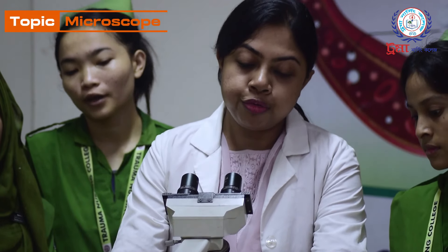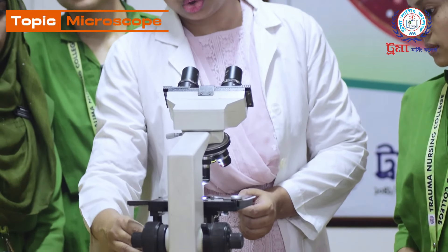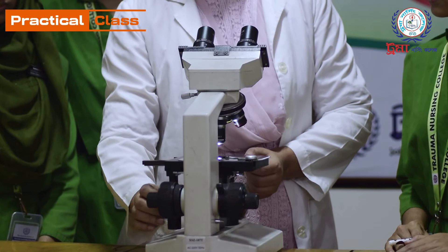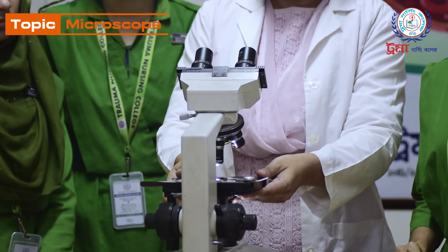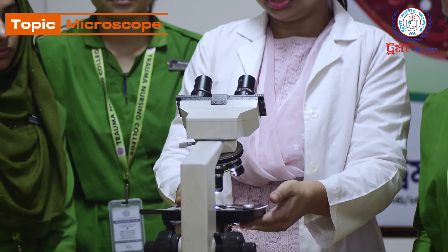Then there is the fine adjustment knob. The fine adjustment is used for a finer, more precise view and focus. This is the stage control. And this is the iris diaphragm.